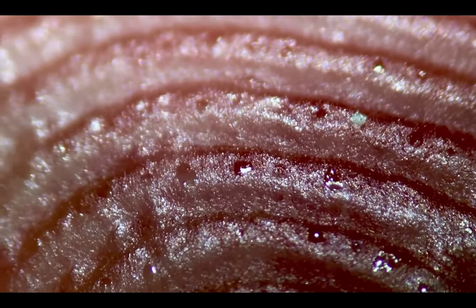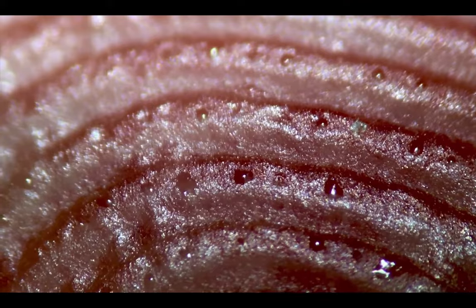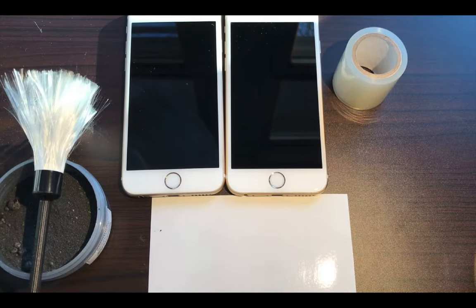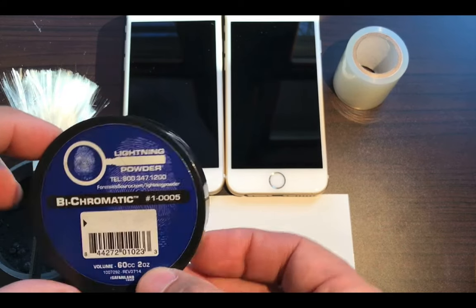So you see just how much more weight your case could carry in a courtroom with the incredible detail of a plastic print. Let's just take 60 seconds and do a quick lift. So here we got ourselves some bichromatic powder.